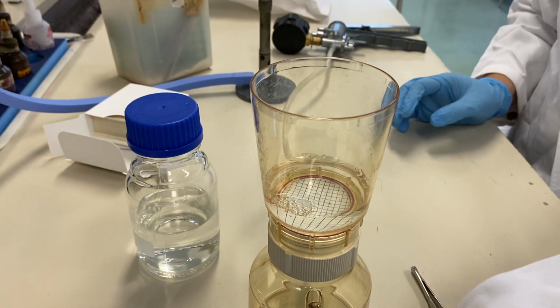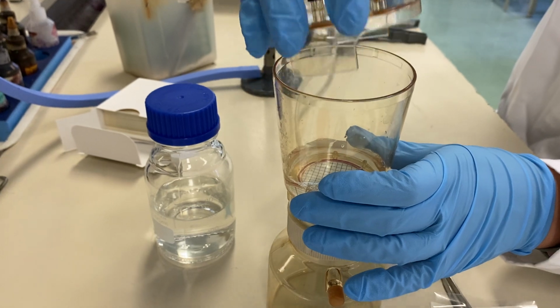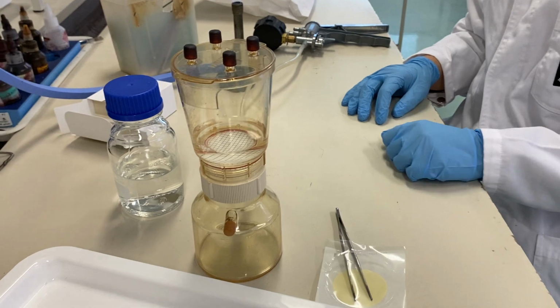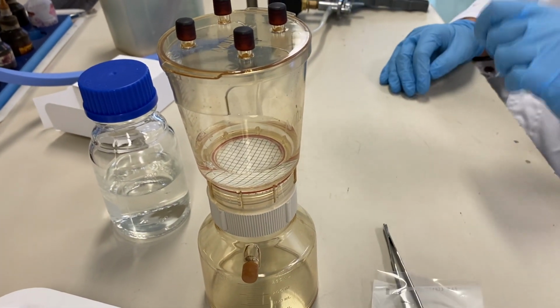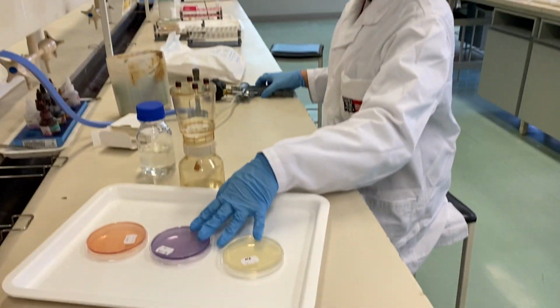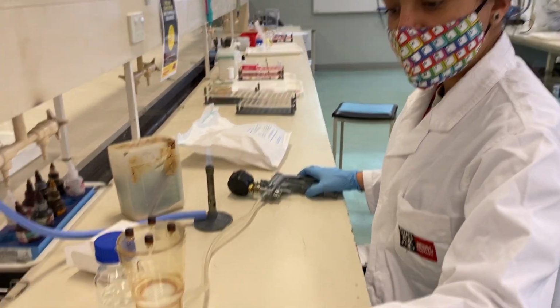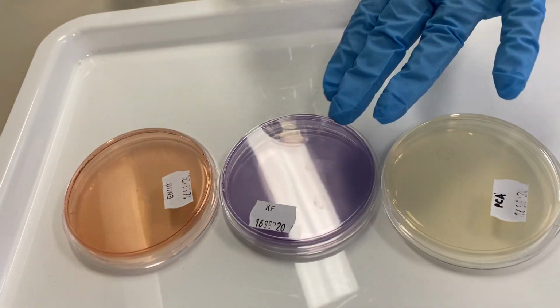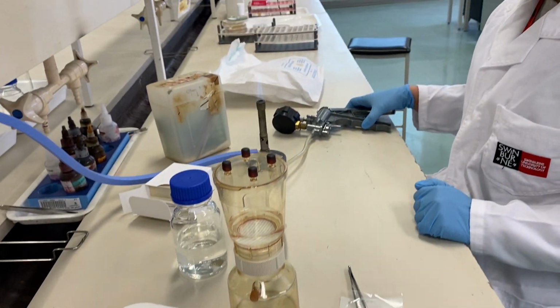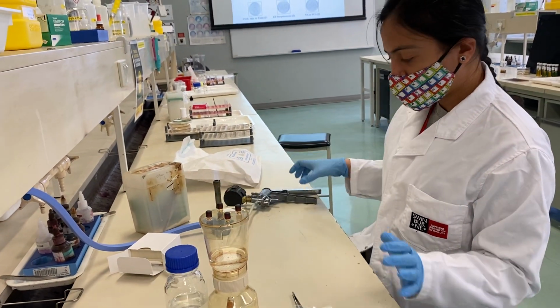So what does this filter do, Sanjida? What will happen is this water will filter through this membrane filter, and whatever organisms we have get stuck in this membrane filter. Then when we incubate those plates, we will see what kind of organisms we have, because these plates are specific for different organisms. You will have a more detailed idea about this at the end of your Prac manual, like which media is particular for which kind of organism.